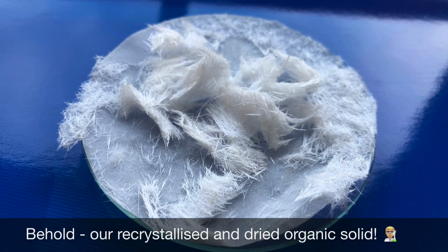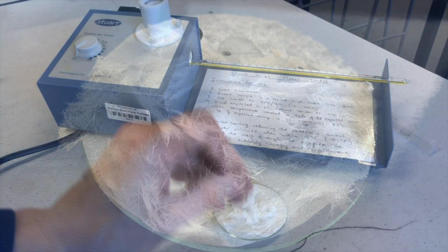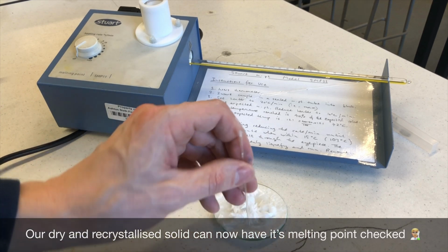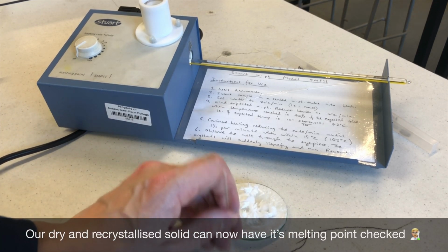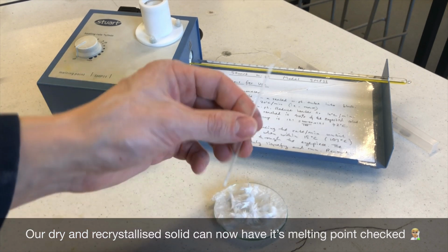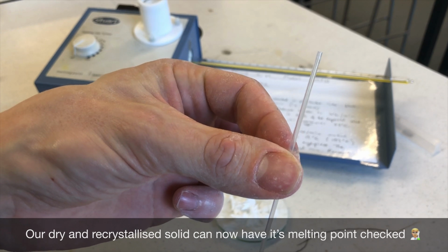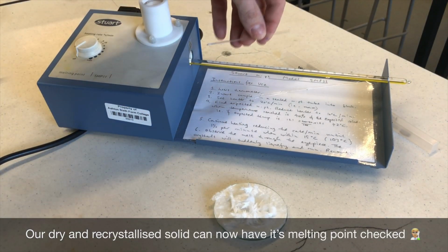Behold, our sample is now dry and ready to have its melting point checked. We transfer a very small amount of the solid into a capillary tube with one end of it sealed. You need to tap the side of the tube in order to make sure the solid drops down to the bottom. This then gets placed sealed end first into the melting point apparatus.